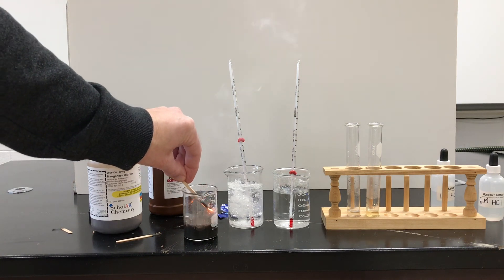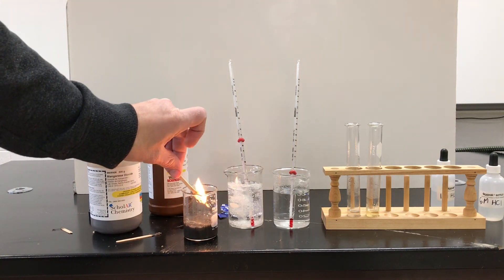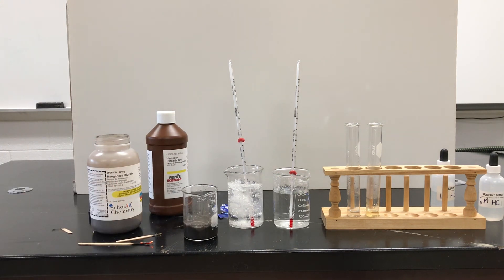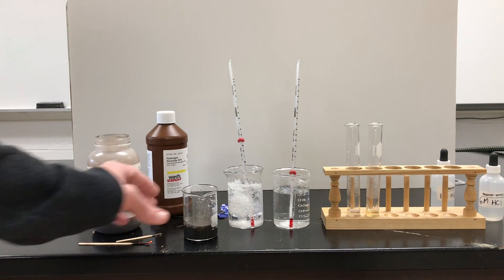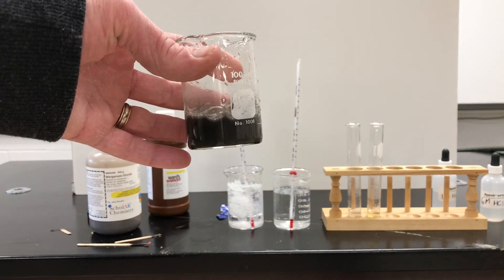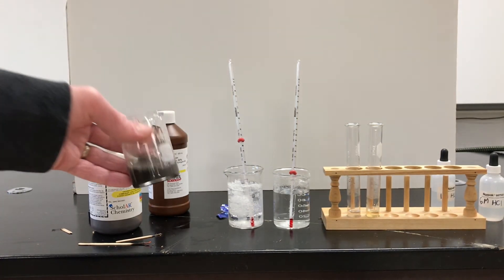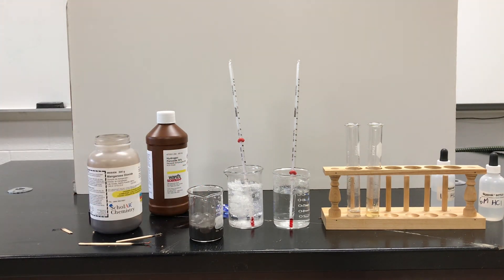So that manganese dioxide is helping that hydrogen peroxide decompose much more quickly than it would normally, giving off that oxygen gas. Now, if I want that manganese dioxide back — that black powder — I could, in theory, let this settle out, filter it, and get that black powder back to be reusable. You can use that manganese dioxide over and over again for this particular reaction.